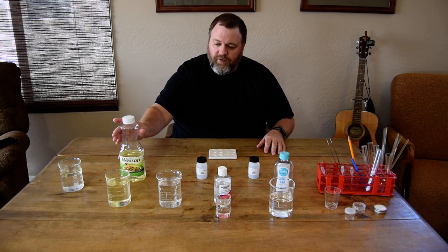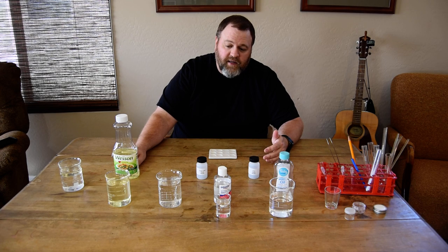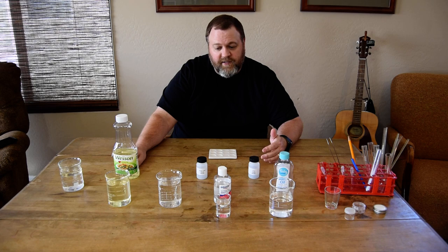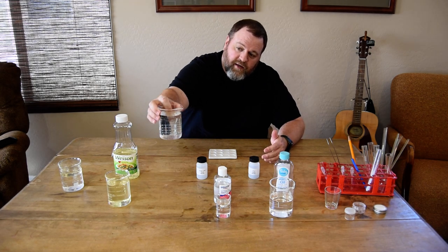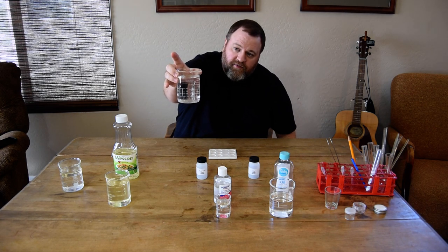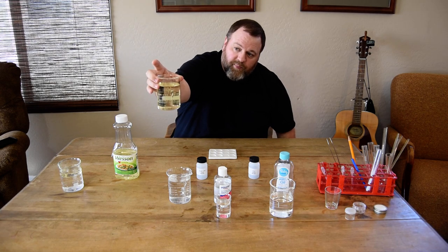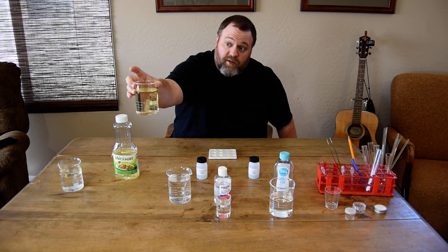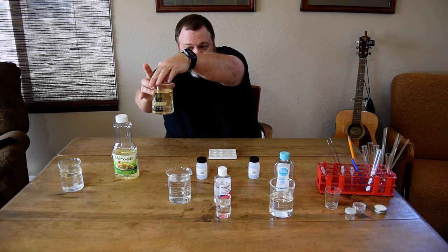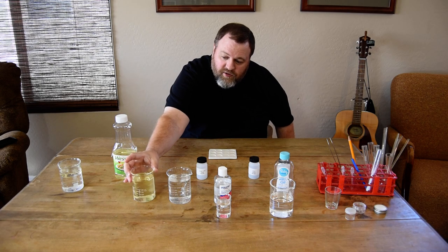This video is going to go through the procedures on how to do that. So if you remember in our last video, I showed you how when you submerge something like a piece of glass into a liquid, if they have different refractive indices, it's pretty easy to be able to see that glass. For example, inside of this beaker here, I have this smaller beaker which is pretty easy to see, because the glass of the beaker and the water have very different refractive indices. But in this other beaker, we put our borosilicate beaker into a beaker that had oil in it, and inside there is a glass beaker which is really hard to see — because the beaker itself has a refractive index pretty close to the oil it's submerged within.